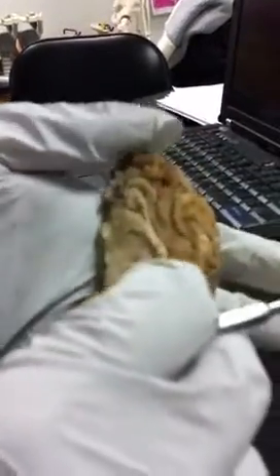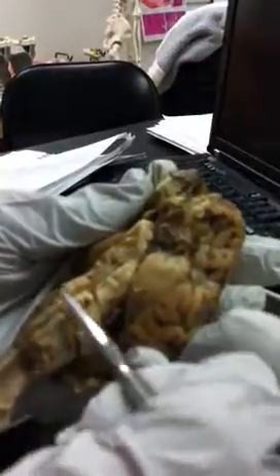And then we did gyrus, we did the sulcus, frontal lobe, parietal lobe, occipital lobe, transverse, vermis. The vermis, if you were to look here, it's pretty much dividing the cerebellar hemispheres. On here, I don't think you can really see it, but it would be dividing here. Okay, yeah. That would be the vermis.